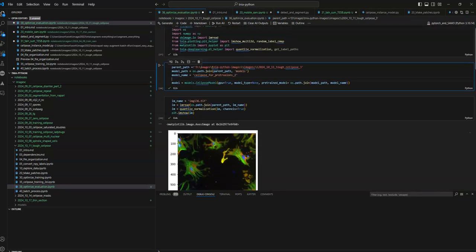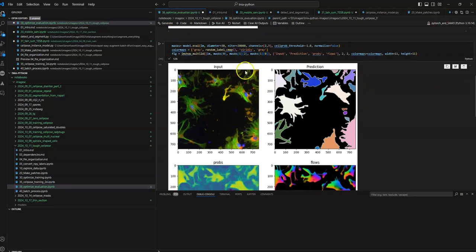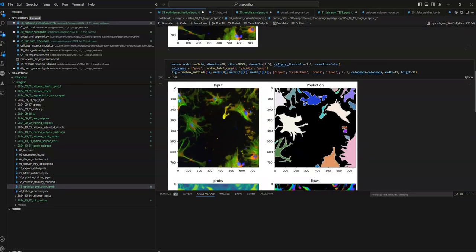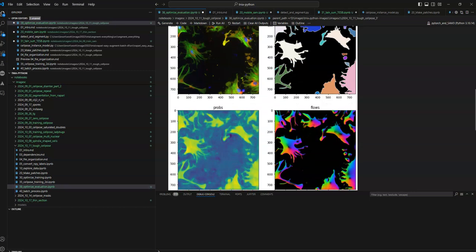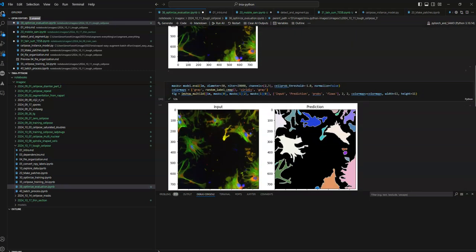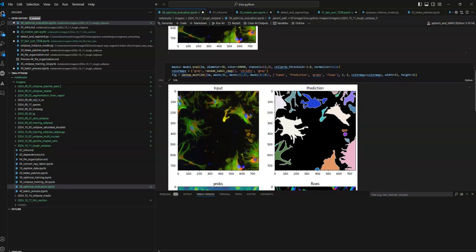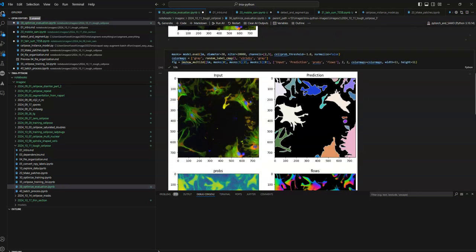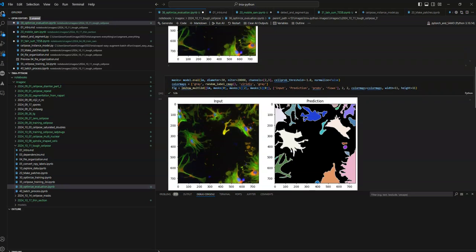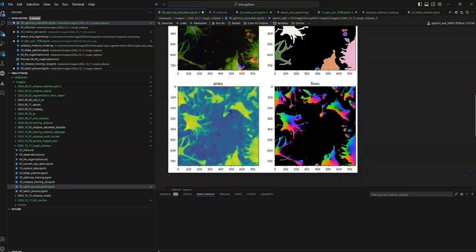So what I've done here is I've loaded in my model, loaded in the image, then evaluated it, using a ton of iterations. I'm also plotting the probabilities and the flows, and they both look okay for this one. So I'm wondering exactly what's happening. Maybe because I'm hacking around with the diameter, I'm using it in such a way that I'm trying to stop the rescaling from happening, but maybe that's causing something else to happen, because if you look at the probabilities and the flows, they both look good for this one object that we haven't quite got. So this is still a bit of a mystery that I'll hopefully figure out with the help of the forum in the next few days.